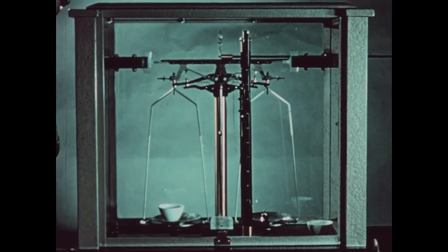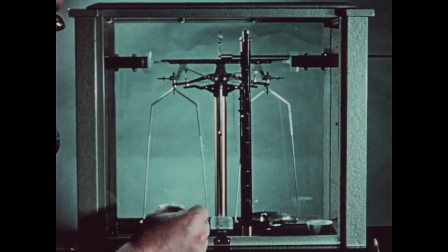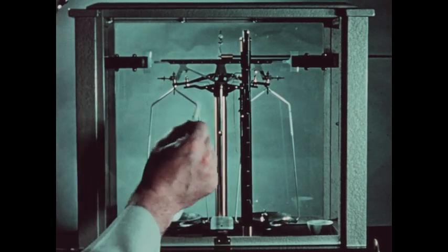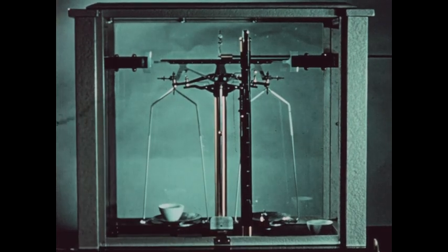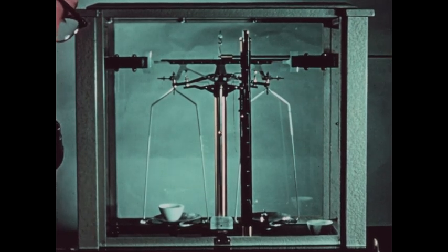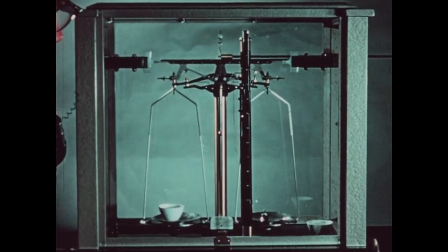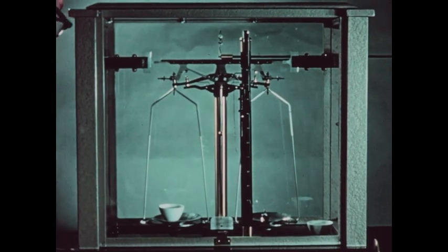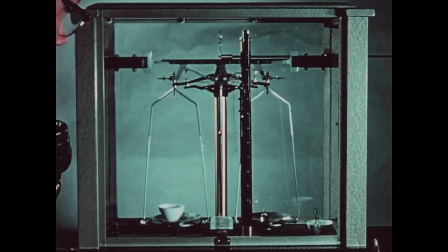By lowering the door to prevent drafts from disturbing the balance setup, we note that the needle is right at the midway mark on the scale. We can read the weight of the crucible: it weighs 10.428 grams. This crucible for use in experiment two has been weighed in an entirely similar manner and it weighs 10.361 grams. Both weights should be recorded on your data sheet.